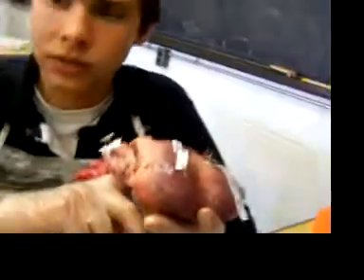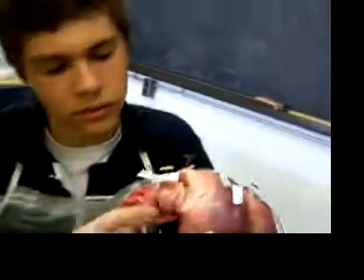There's a hole which Dave is sticking his finger in to find the opening. Do you know where the vena cava is? It's been cut off. Just slide your finger in one of them and it'll come up the other side. What about the pulmonary vein and the inferior vena cava? Superior vena cava too.